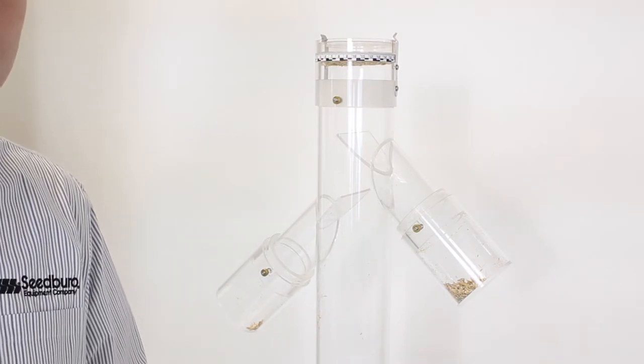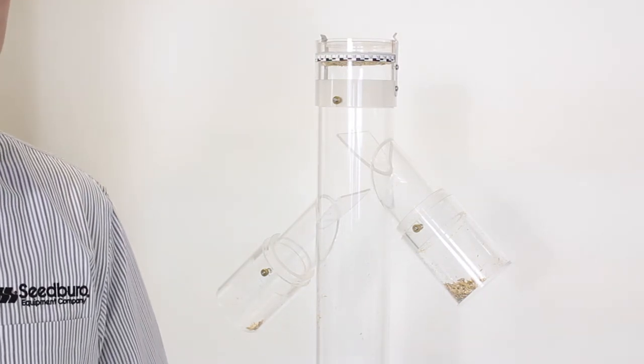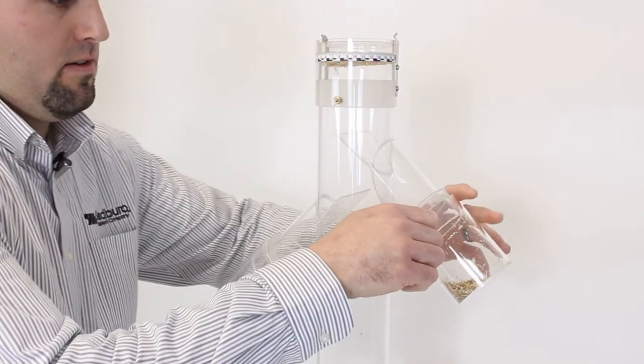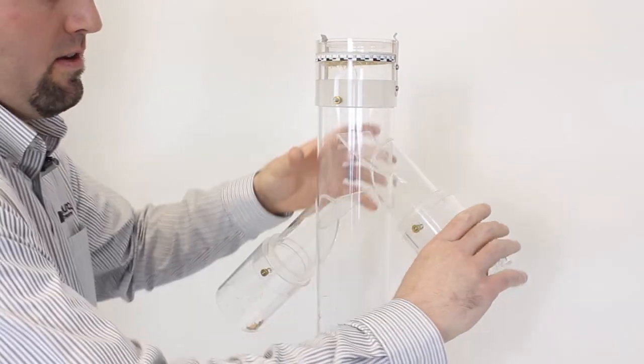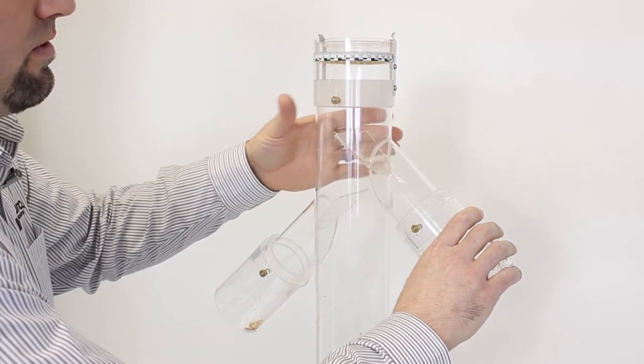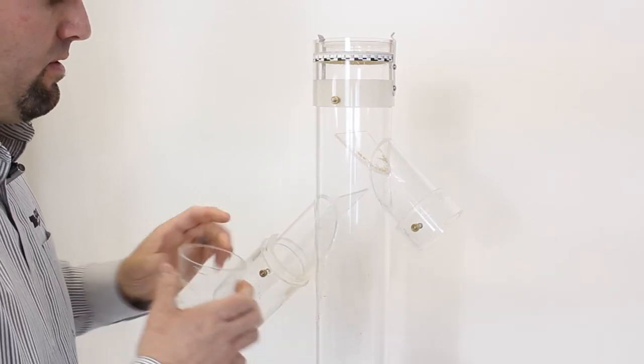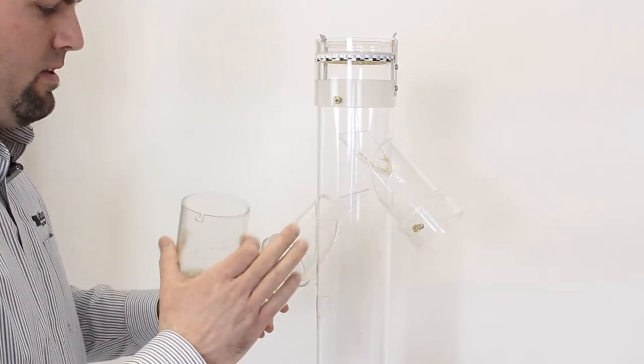When that sample is clean, I'm going to then turn off my timer, wind out my set screws, and allow the dust and debris and chaff to remove into the cups.